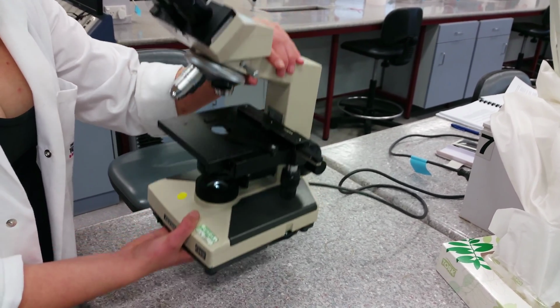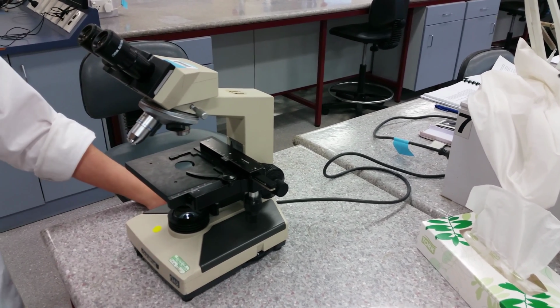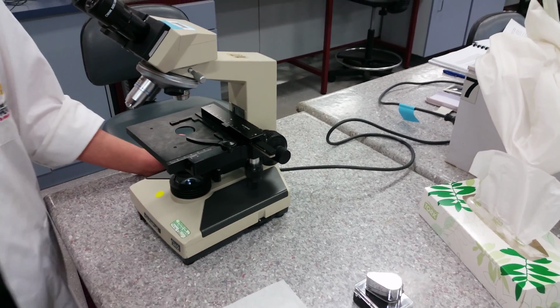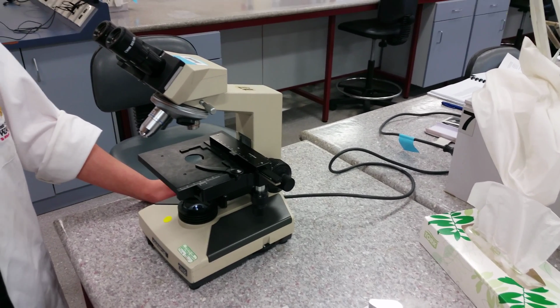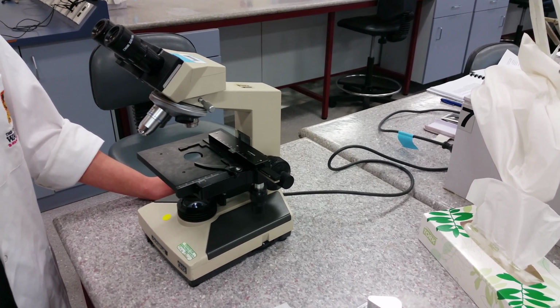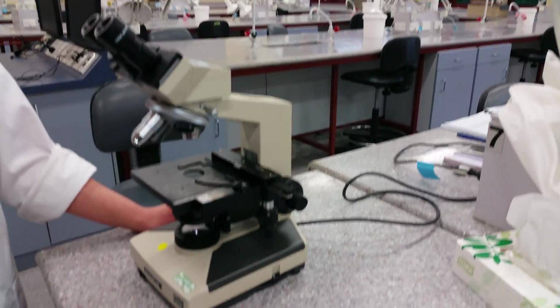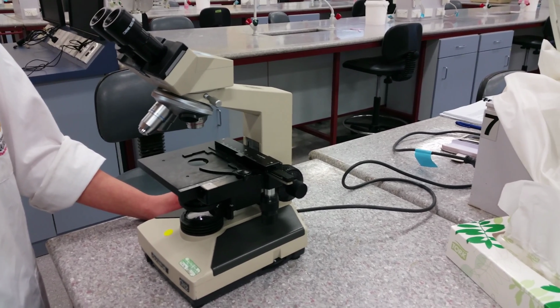The light microscope is used to magnify specimens many times larger than their original size. Along with the magnification, a researcher can observe specimens and measure the actual size of the object. Another advantage, living objects can be observed moving. Really cool. From its origin several centuries ago, the light microscope hasn't changed in its basic form, but has evolved in complexity. It still uses light passing through the lenses to magnify the object.